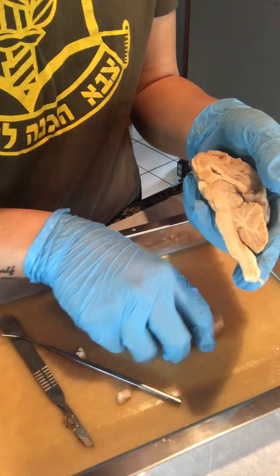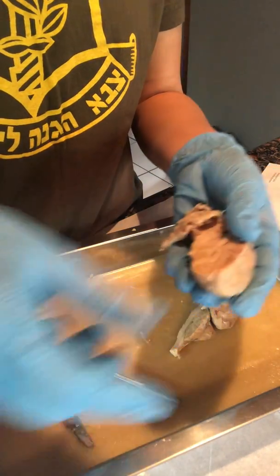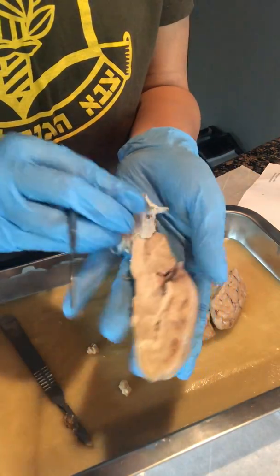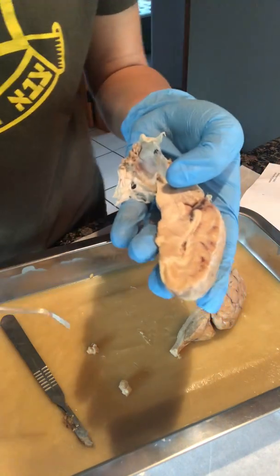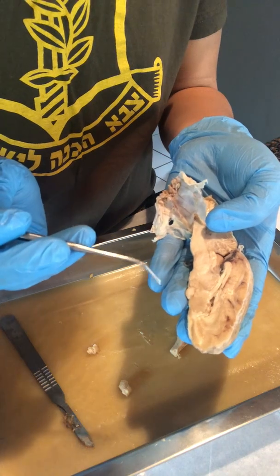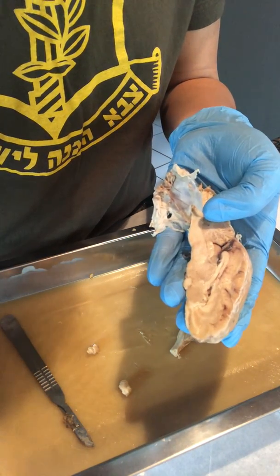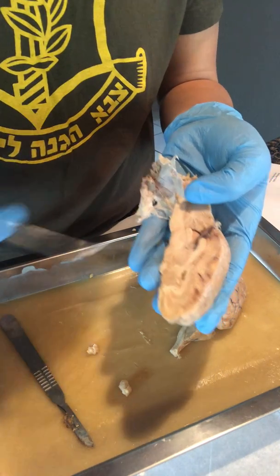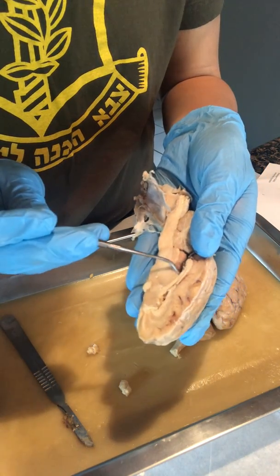And then this might be a little bit easier on this side. Our septum pellucidum, this one's a little difficult to point out, but it's kind of where our lateral ventricle is, kind of this portion on here. And then our choroid plexus, if I'm saying that correctly, is going to be found kind of in here in our third ventricle.